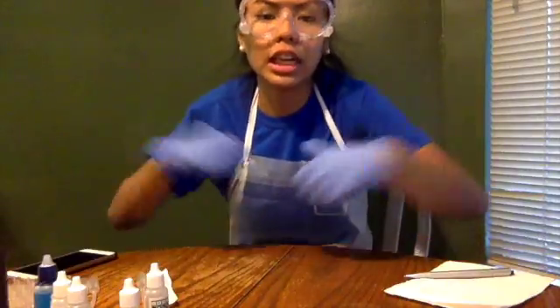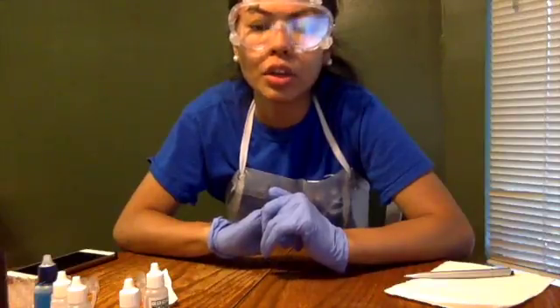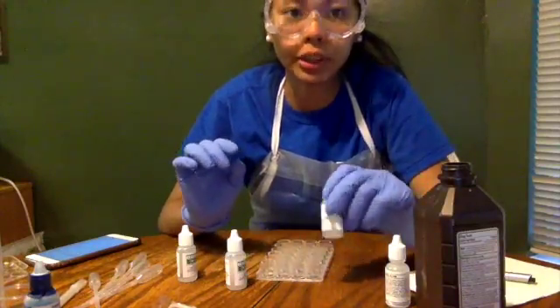I'm Carmela Solis, and I'm going to be doing the first experiment on factors affecting rate of reactions. So for the first activity, we're going to do the calibrations test.